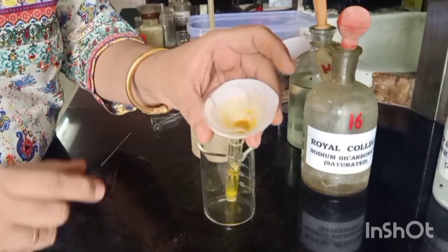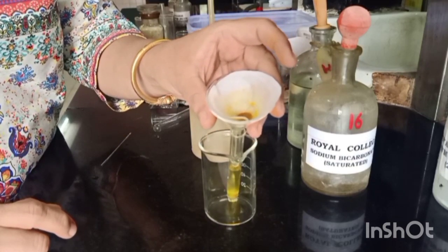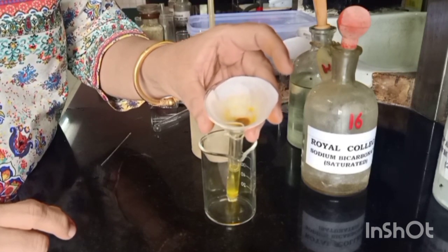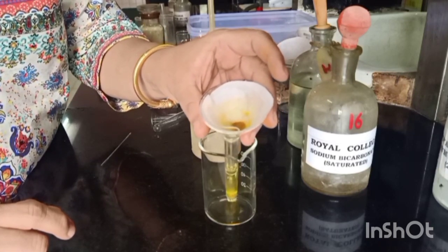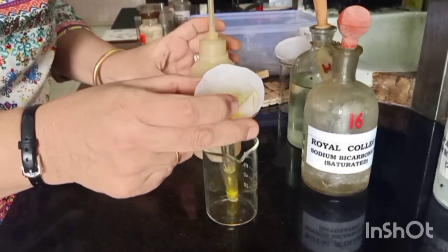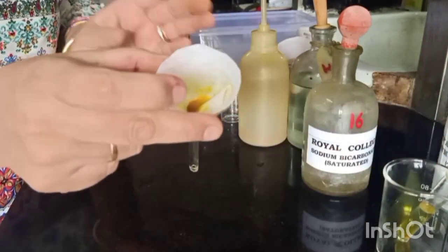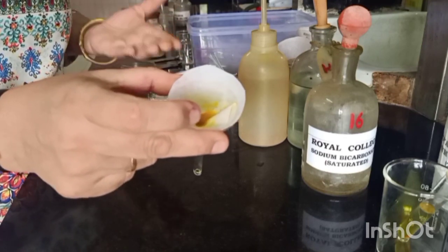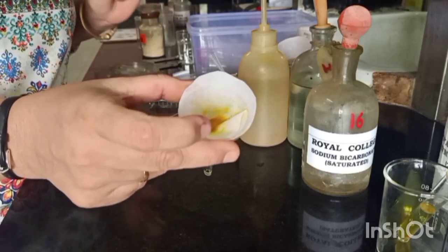As you can see, we have got a distinct yellow colored residue. The presence of a yellow or green colored compound is normally indicative of the presence of nitrogen. So when we are doing the Lassaigne test, we need to be particularly careful and check for the presence of nitrogen. Now that we have this washed residue, which is free of our acid and also free of whatever reagents we used in the earlier step, we will now proceed to check for the presence of a phenol.